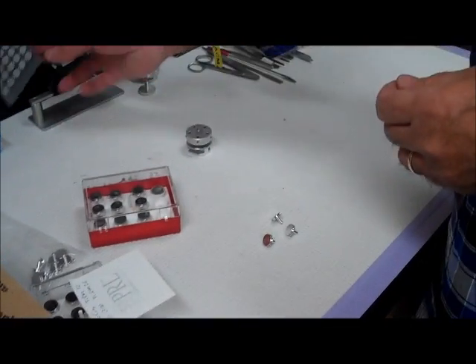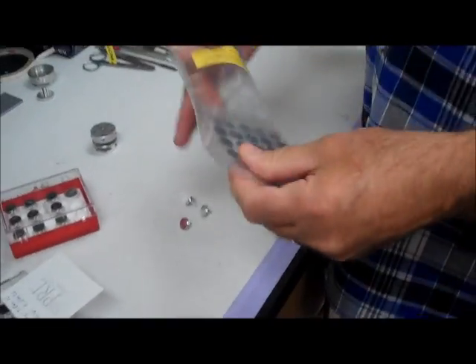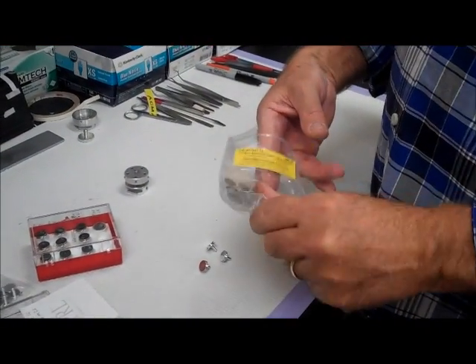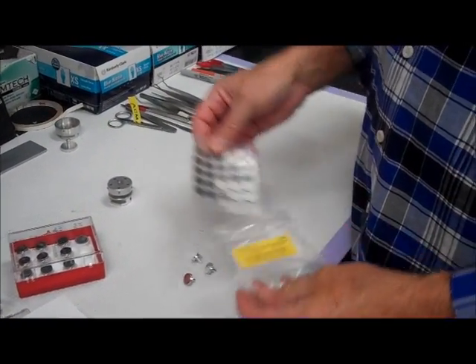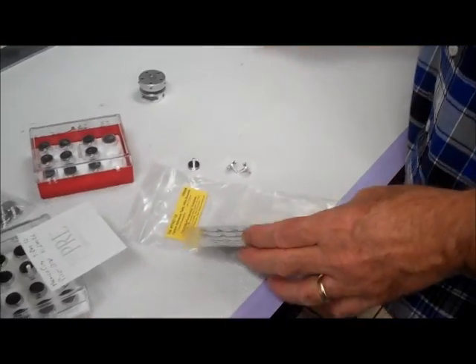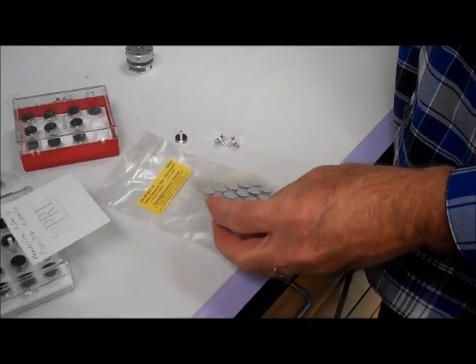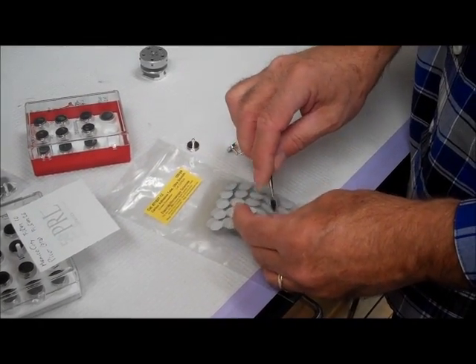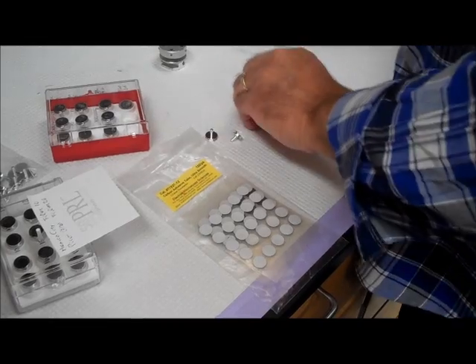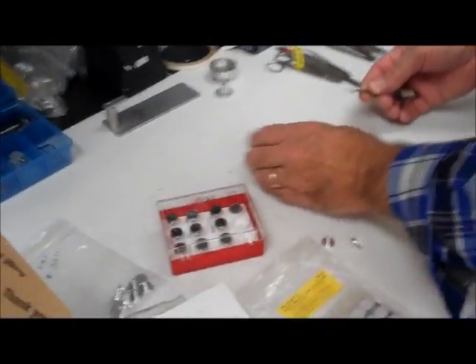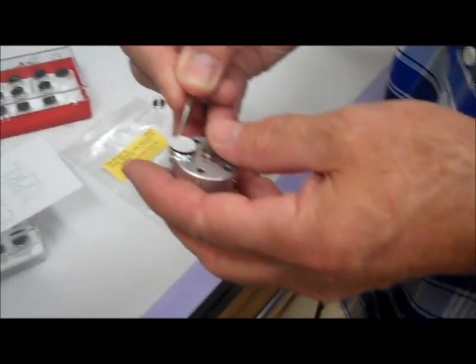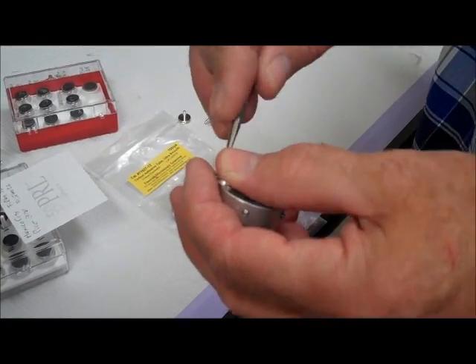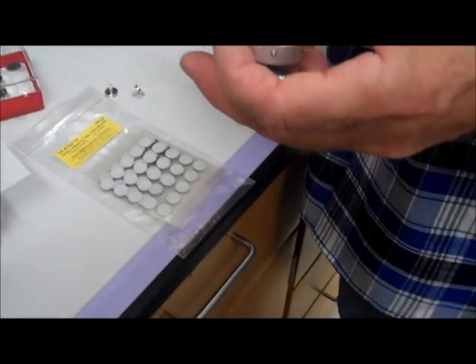So all we do is we use these little double stick adhesive pads, and they just come off like this, and then we do that, and then pull the cover off.